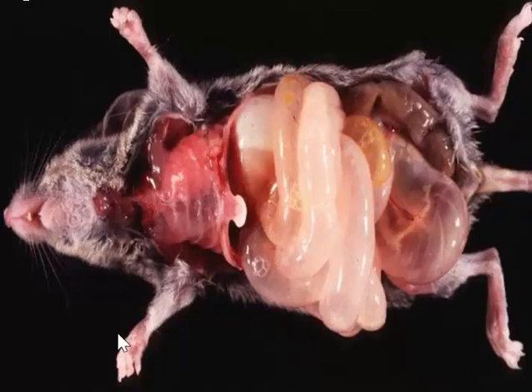Here is an interesting, somewhat nonspecific lesion of marked abdominal or intestinal dilation or adynamic ileus. The first thing that I'm going to think about when I see this lesion is, was the animal inoculated intraperitoneally with some type of anesthetic agent? Classic lesion that often results in ileus and marked distension.